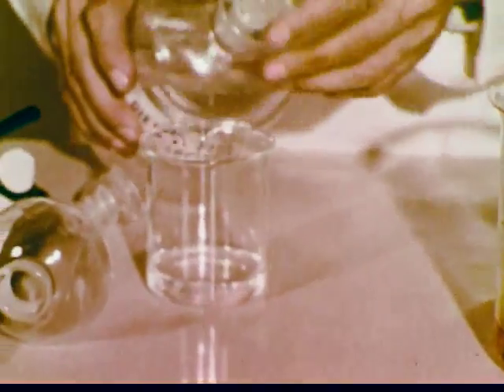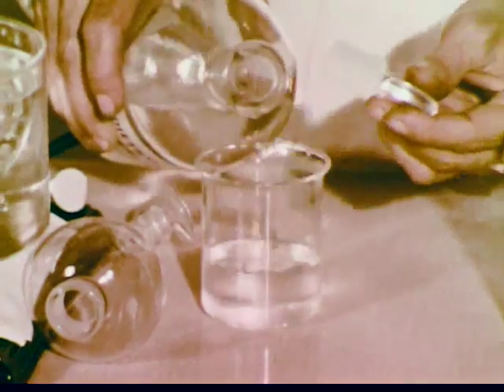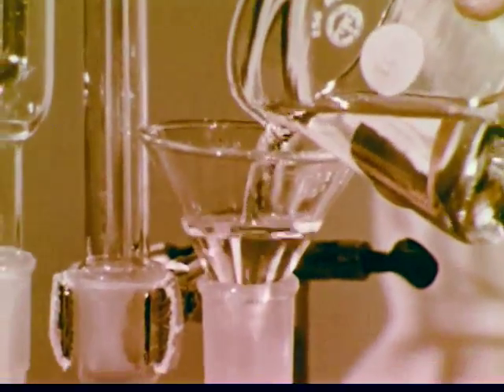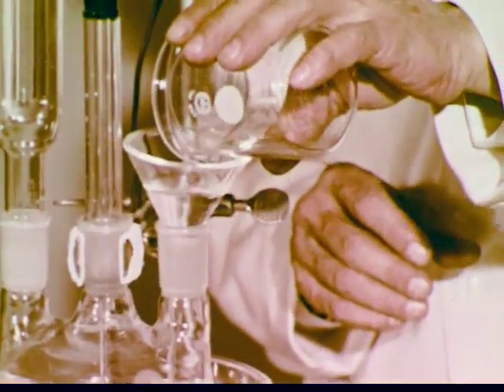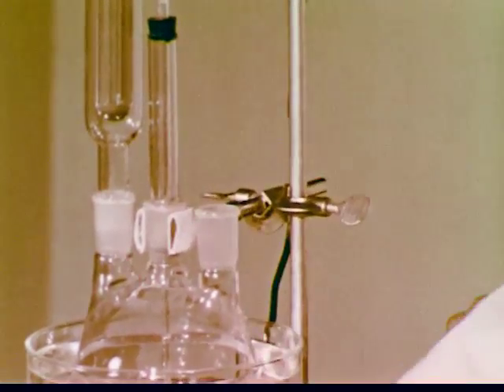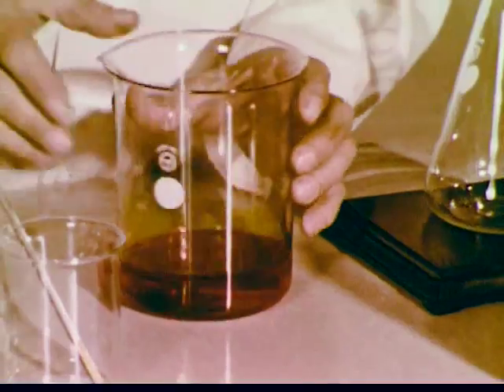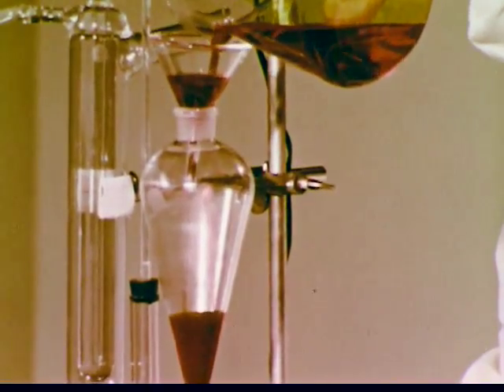Diethyl ether is used to dissolve the butanol. The amount of ether added is not critical because it is not consumed in the reaction. Rather, the ether dilutes the reaction mixture so that the rate of reaction can be more readily controlled. Also, the ether's solvent properties will be helpful in the purification of the product. After the solution of butanol and ether is poured into the reaction flask, the oxidizing solution — made from sodium dichromate, sulfuric acid, and water — is placed in the dropping funnel.